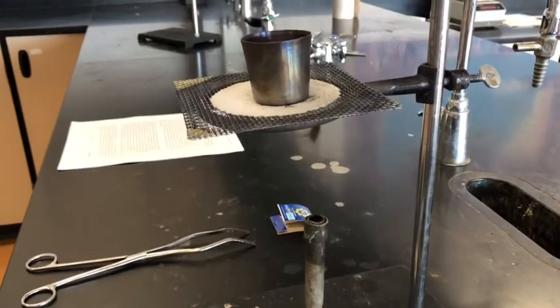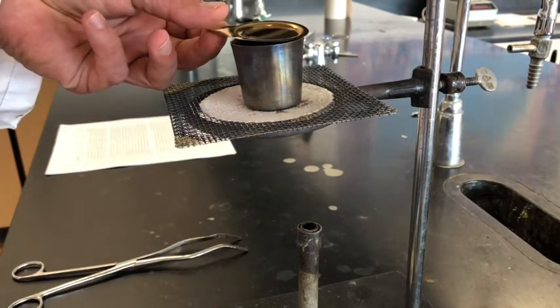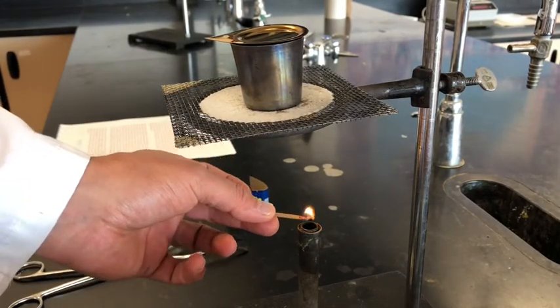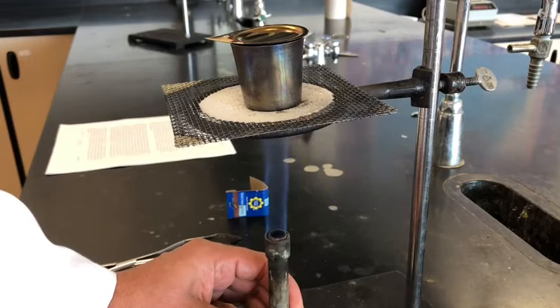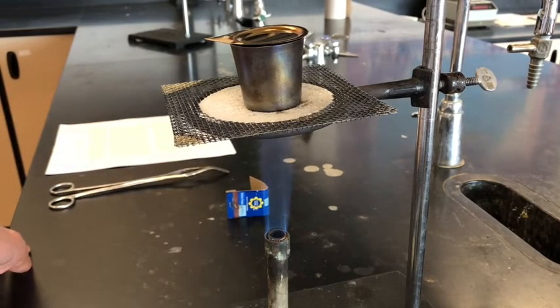And now we're going to heat up the sodium bicarbonate for about a minute. And we're going to put the lid on that, but we're going to leave it cracked open a little bit so that the water vapor can be released. And so during this minute, the sodium bicarbonate will decompose, and it's going to give us some sodium carbonate, which is an inert substance at that temperature.